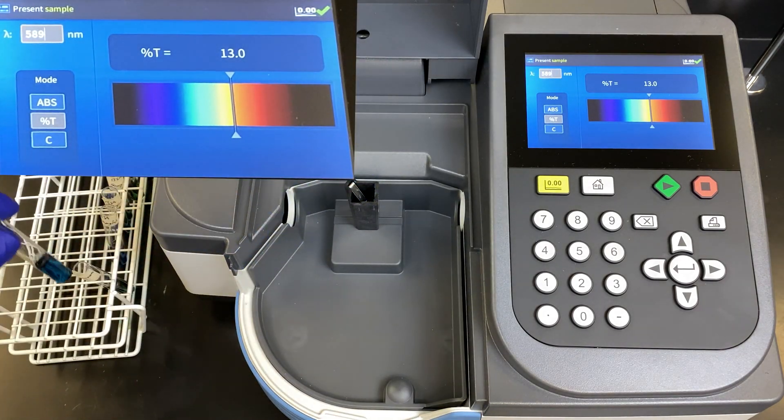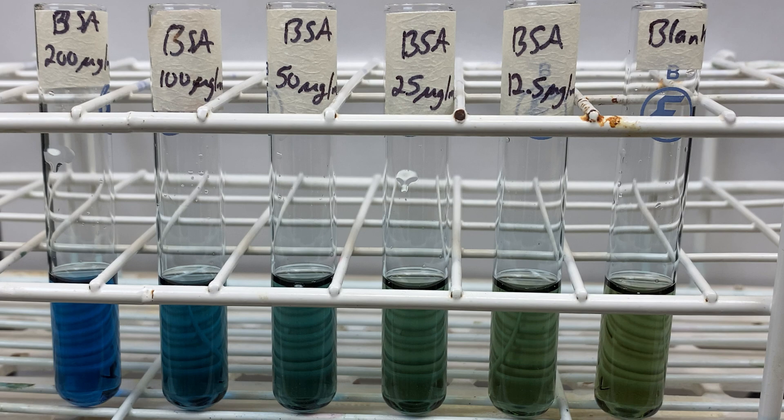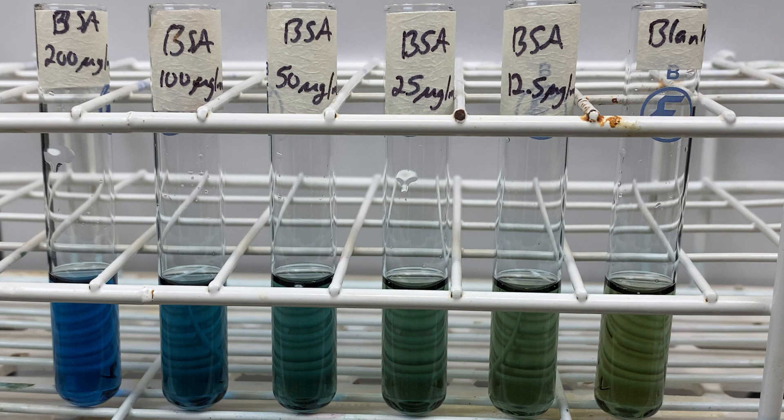You will then use the formula — absorbance equals 2 minus the log of percent transmittance — to convert all of your percent transmittances into absorbances. You will create a standard curve by graphing the absorbance on the vertical axis and concentration on the horizontal axis. Plot all of your known standards and connect a line of best fit, which hopefully is a straight line. Sometimes at higher concentrations the standard curve can plateau out. Compare the absorbances of your unknowns: draw a horizontal line from that absorbance until it hits the line of best fit, then draw a vertical line down to read the concentration off the horizontal axis. Alternatively, you can get a formula from your line of best fit, plug in your absorbance value, and it will calculate the concentration.